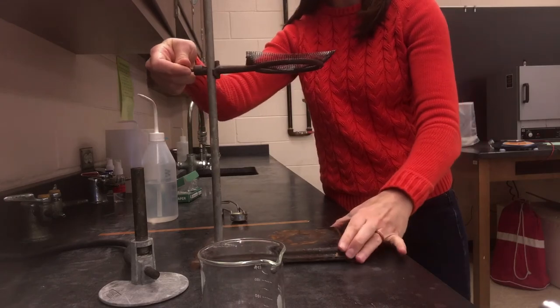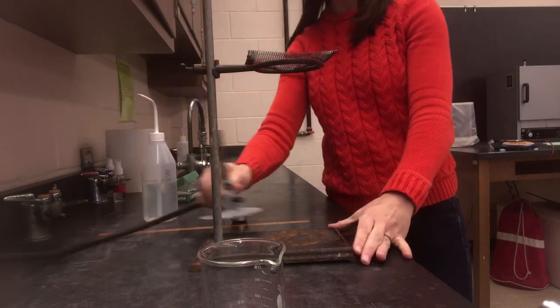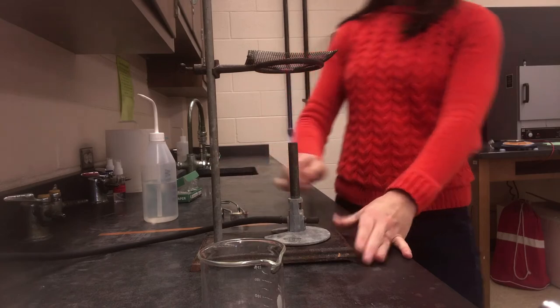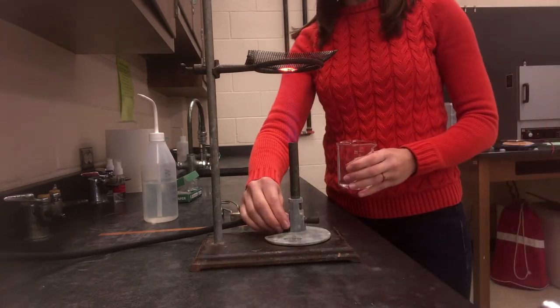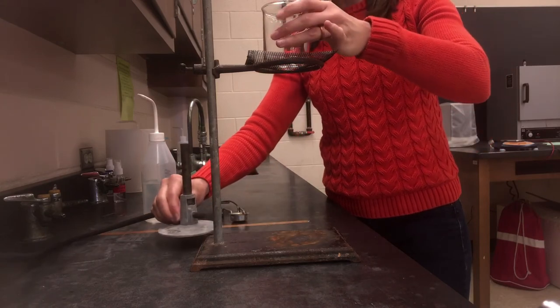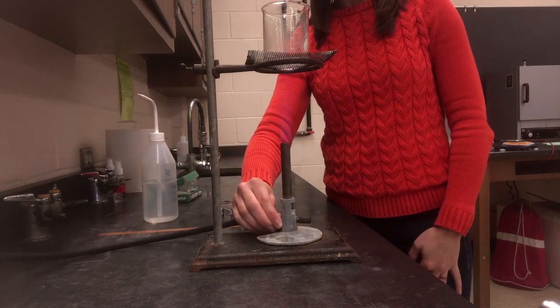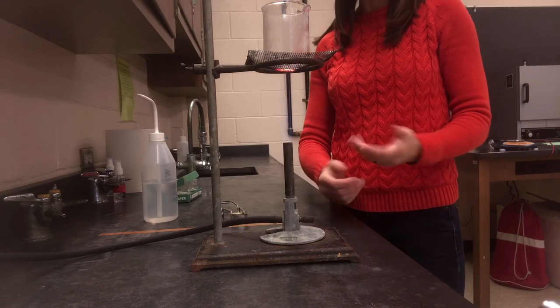You can make sure you've got about the right height. That looks pretty good to me. And then when you're ready again, you can place your beaker over the flame to begin the heating process or whatever it is that you happen to be heating.